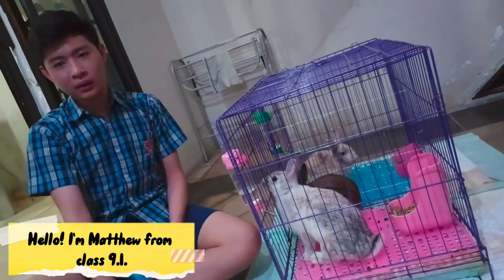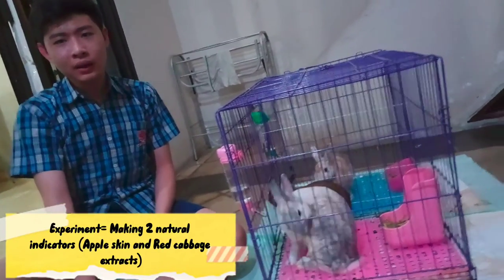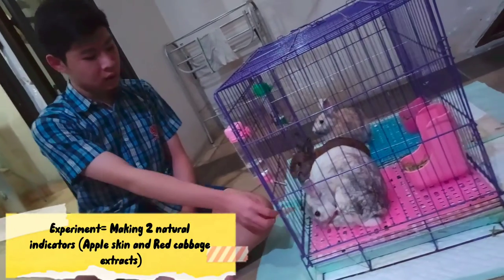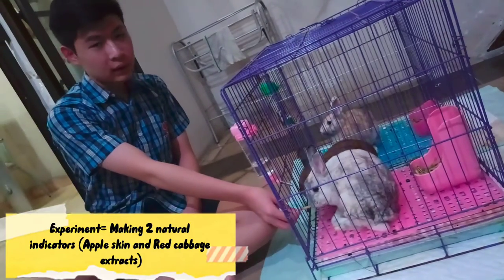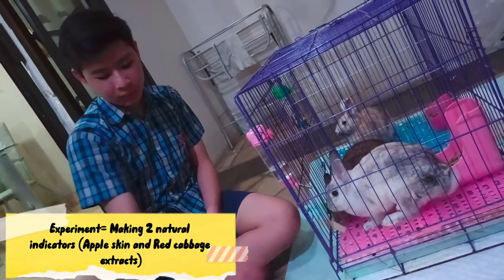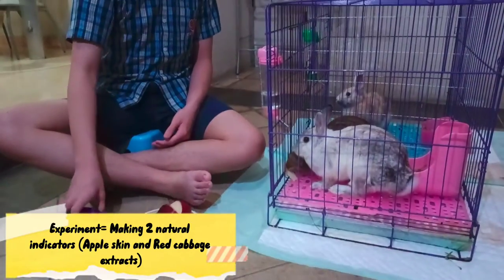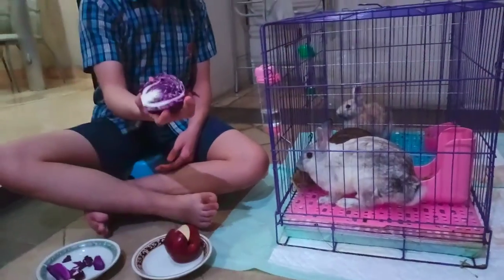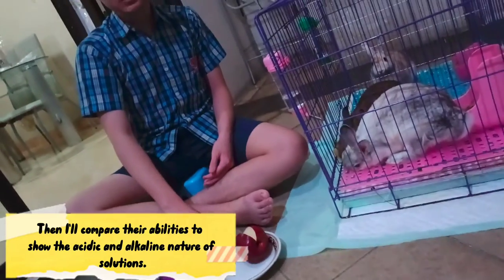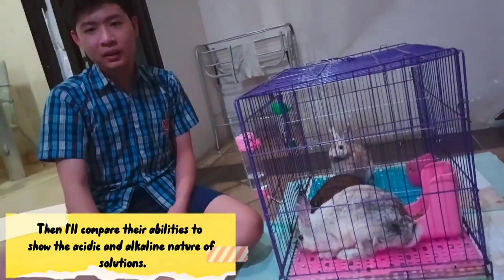Hello everyone, I'm Matthew Orlinci from 9.1. Today I'll be conducting an experiment on making two natural indicators. I'll be making an apple skin extract and a red cabbage extract, then I'll compare their abilities to show the acidic and alkaline nature of solutions.